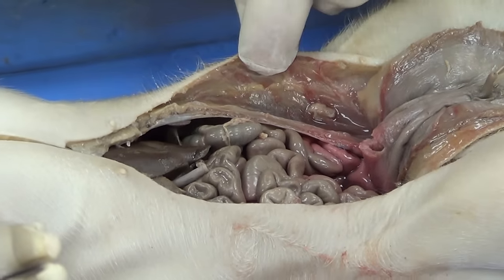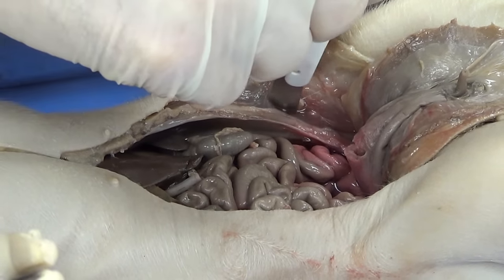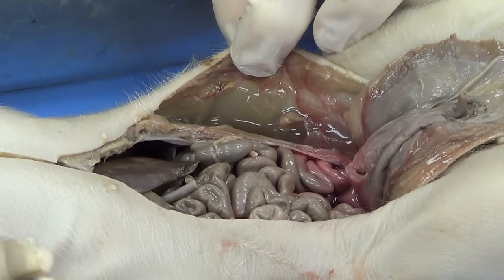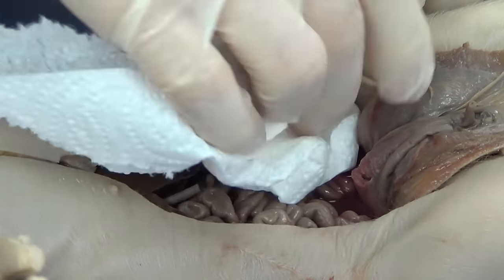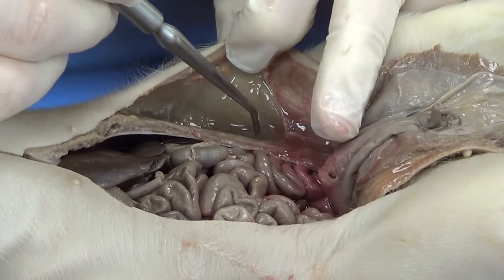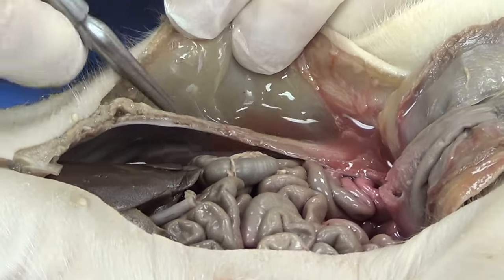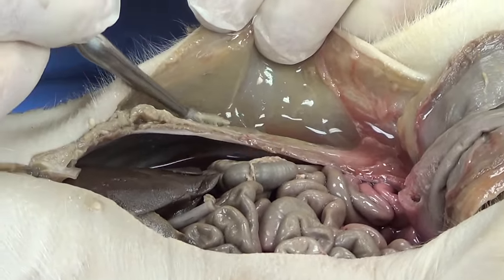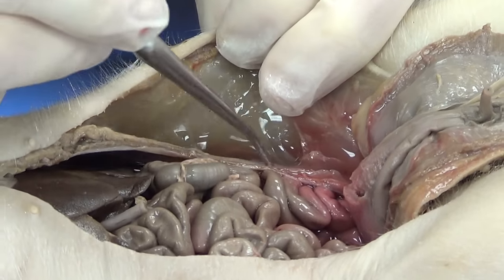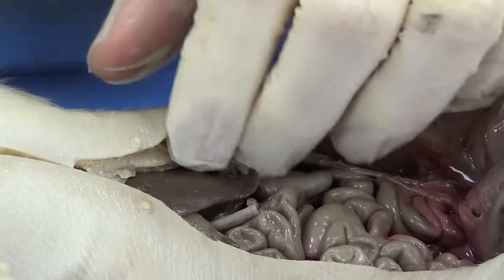I'm going to reflect the skin a little bit here and cut through some tissue. I'm going to wick up some of the liquid so we can visualize this better. You can see some saran wrap-like tissue here — I'm putting the probe right through it and tearing through it a little bit. You can see the fibers right here. Those are fibrous connective tissue, which hold the skin firmly to the abdominal muscles. I'm going to cut some of the skin out of the way so we can see a little bit better, and be very careful with the fingers.